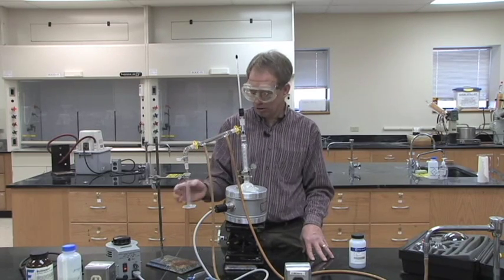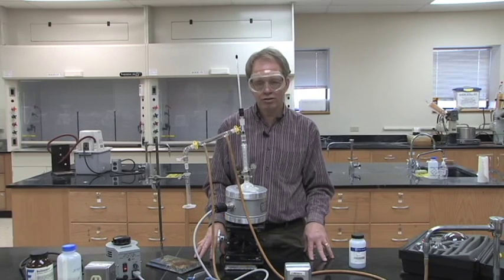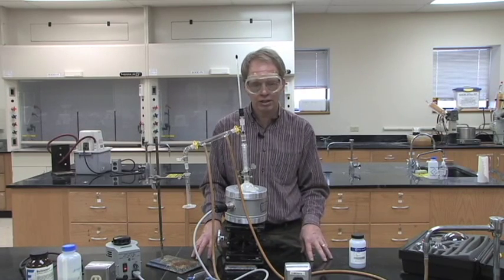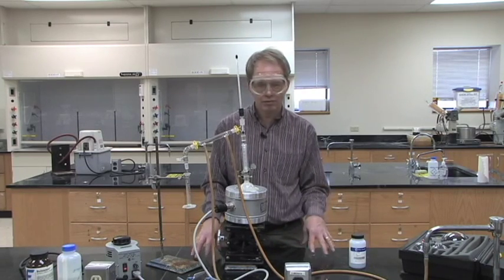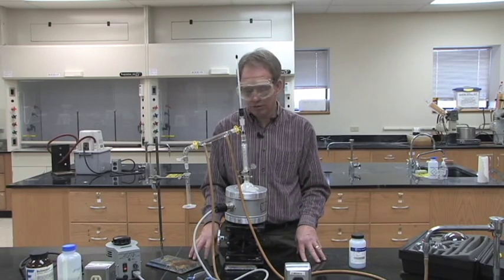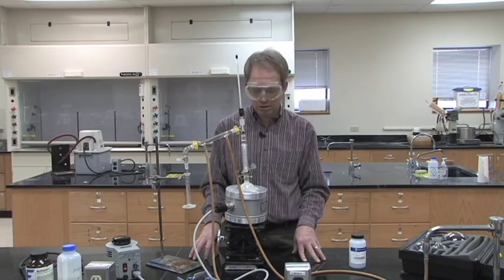Of the three fractions, then you can go over to the refractive index and run a refractive index on all three to see what percentage you have of each of your two compounds in each of your fractions from the distillation.